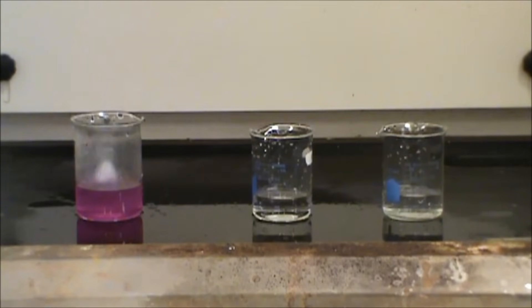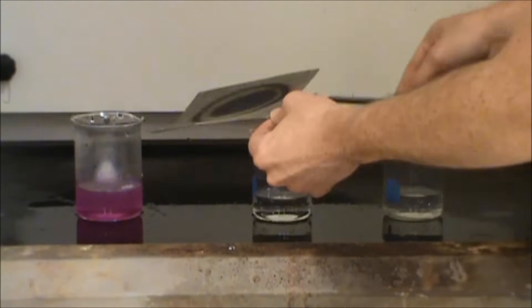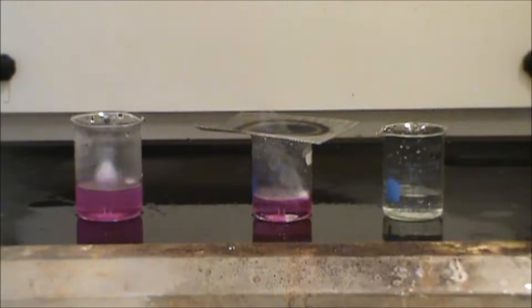I'm going to put sodium into the next one, and the sodium is actually probably going to ignite. So you'll see some orange flame, perhaps, or some sparks or some shrapnel.